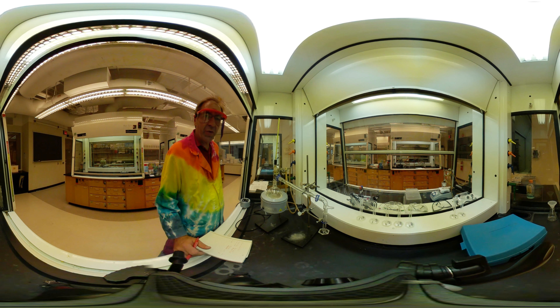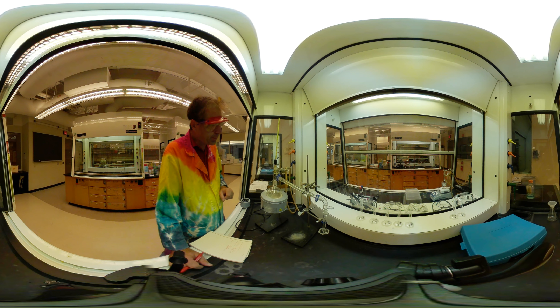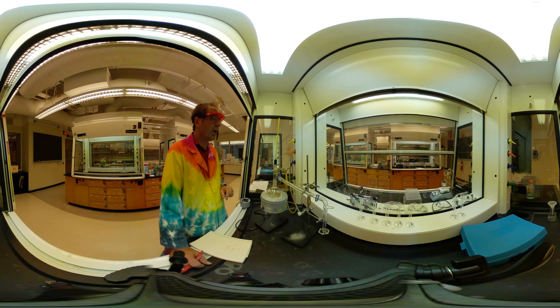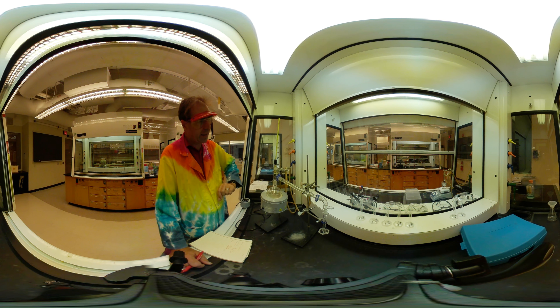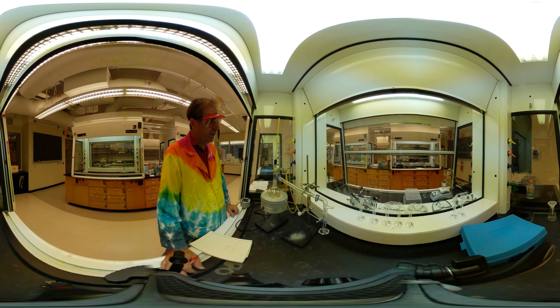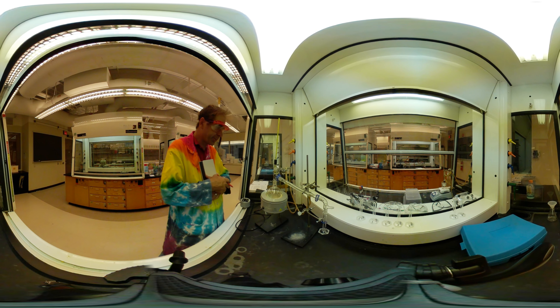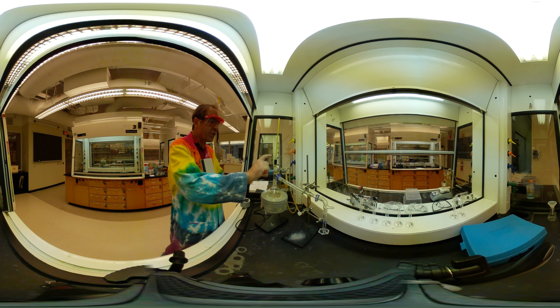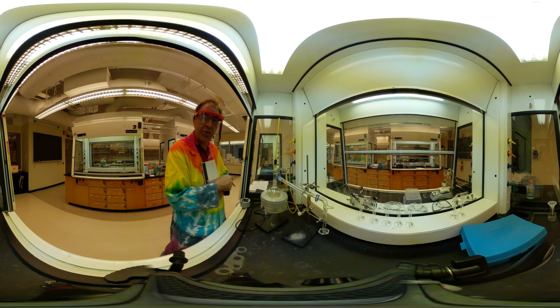I've been heating for a while now and you can see that we've got boiling going on in here and that the temperature is starting to rise. We're up about 45 degrees, so the vapor edge is getting up towards the thermometer. Very soon we're going to start with our collection here. So I want to bring back the video so you can see that as it begins, and you may be seeing some condensing here.